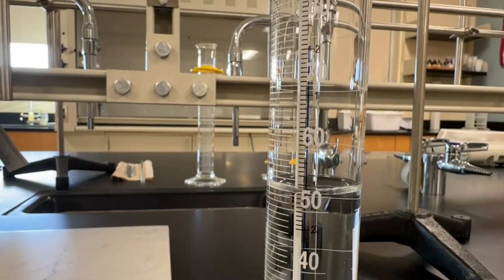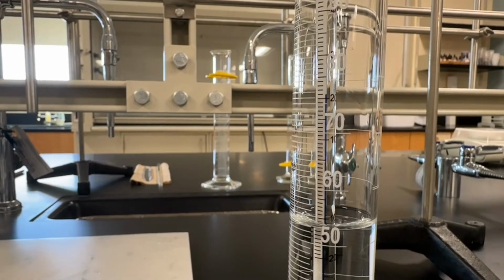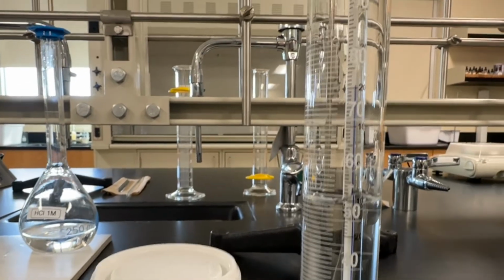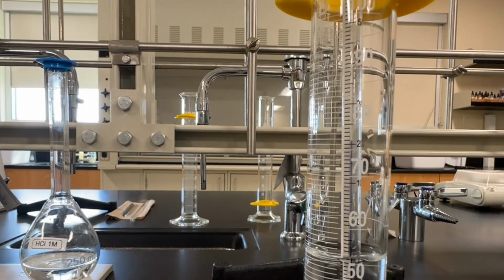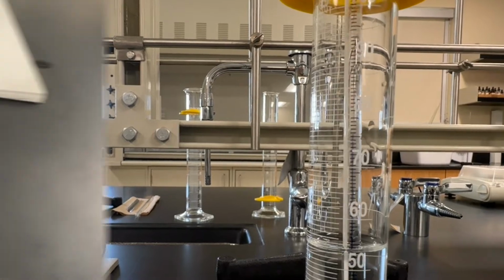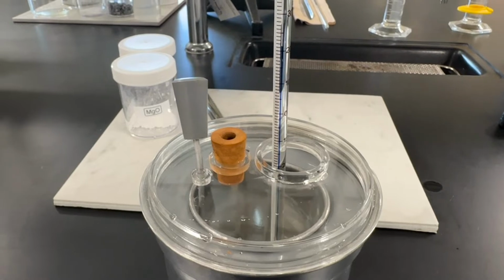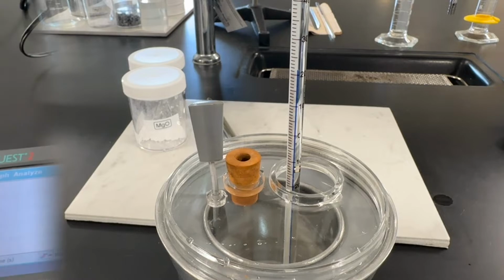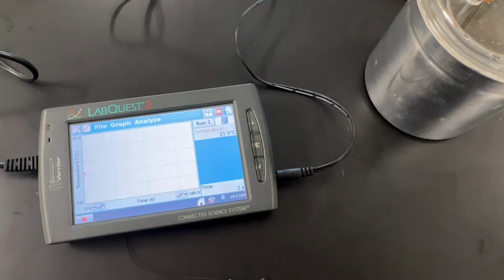So the first thing that we're doing is measuring 50 milliliters of 1 molarity hydrochloric acid, and we are taking the temperature. It's 20.9 degrees Celsius. Then we're going to take our 1 molarity sodium hydroxide, again 50 milliliters, and we are going to get the temperature of that as well. And we get 21.1 degrees Celsius. We're measuring it again inside the calorimeter, just in case the calorimeter would have thrown off the temperature at all. And you'll need those again to find the average starting temperature shown in the lab report.